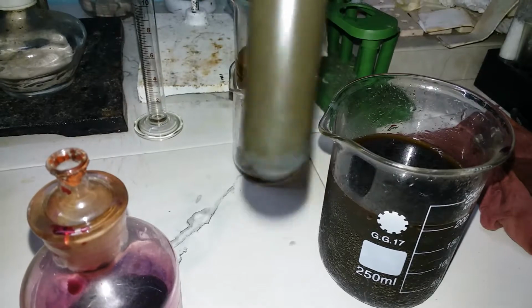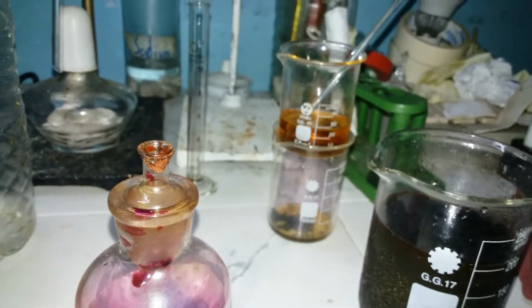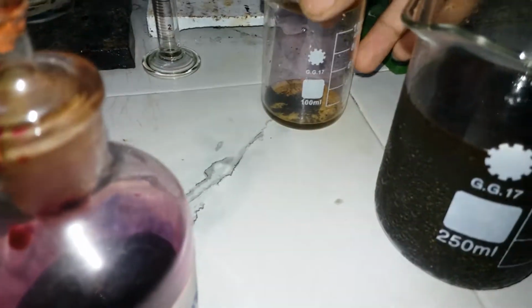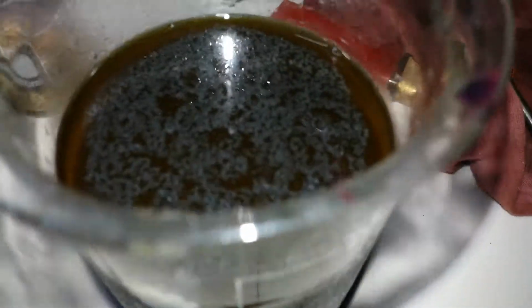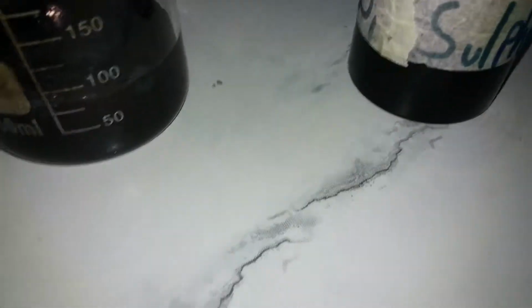So it is really fine, but still would work. So from the test tube, I earlier extracted this much iodine. Well, now I'm gonna extract these. Well, I'll come back when I've set up my setup.